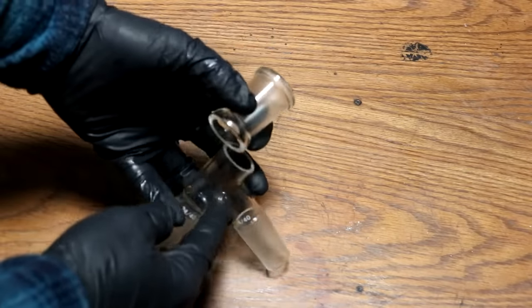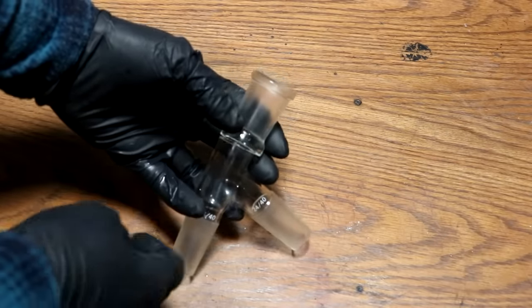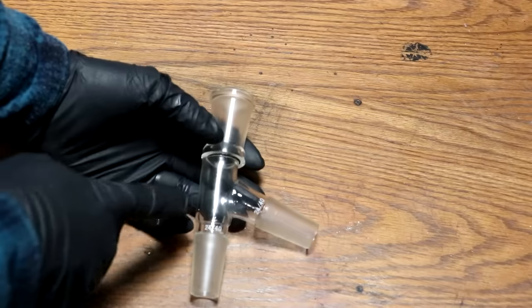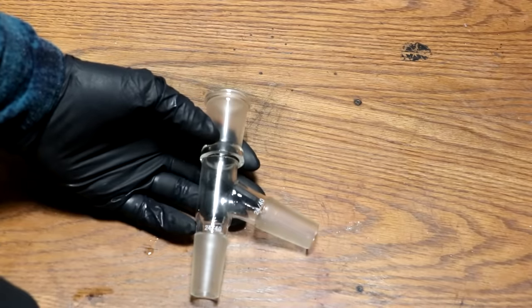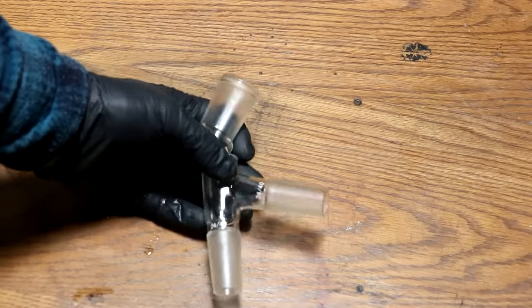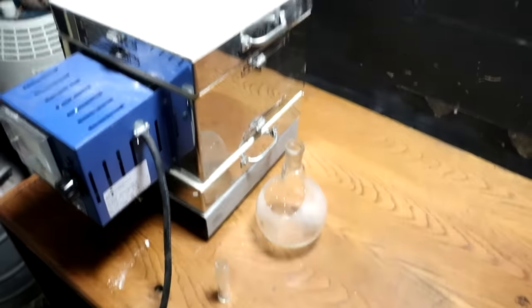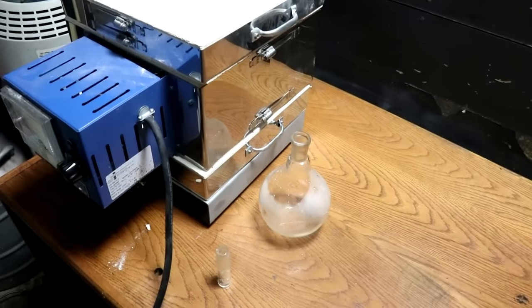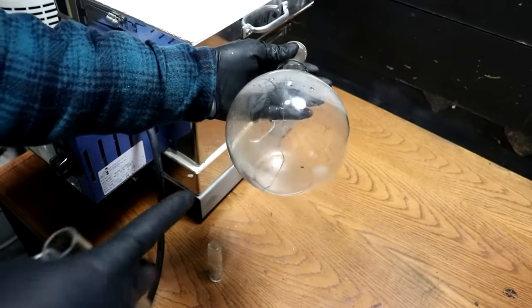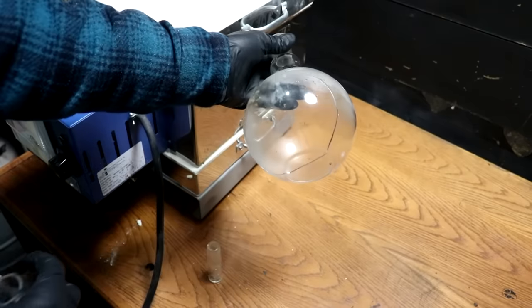Now, I was going to try to do this with a blowtorch, but I just don't think that'll put out enough heat. So I'm going to have to use the oxyacetylene torch. The problem with that is it puts out too much heat, and it will cause the glass to break as soon as I hit it with the flame. So I'm going to have to pre-warm this. So, got a little furnace here, which I can use for that purpose. I've also got another flask, which is more or less okay, except it's got this nasty crack going through it. I'm going to see if I can fix this today as well.